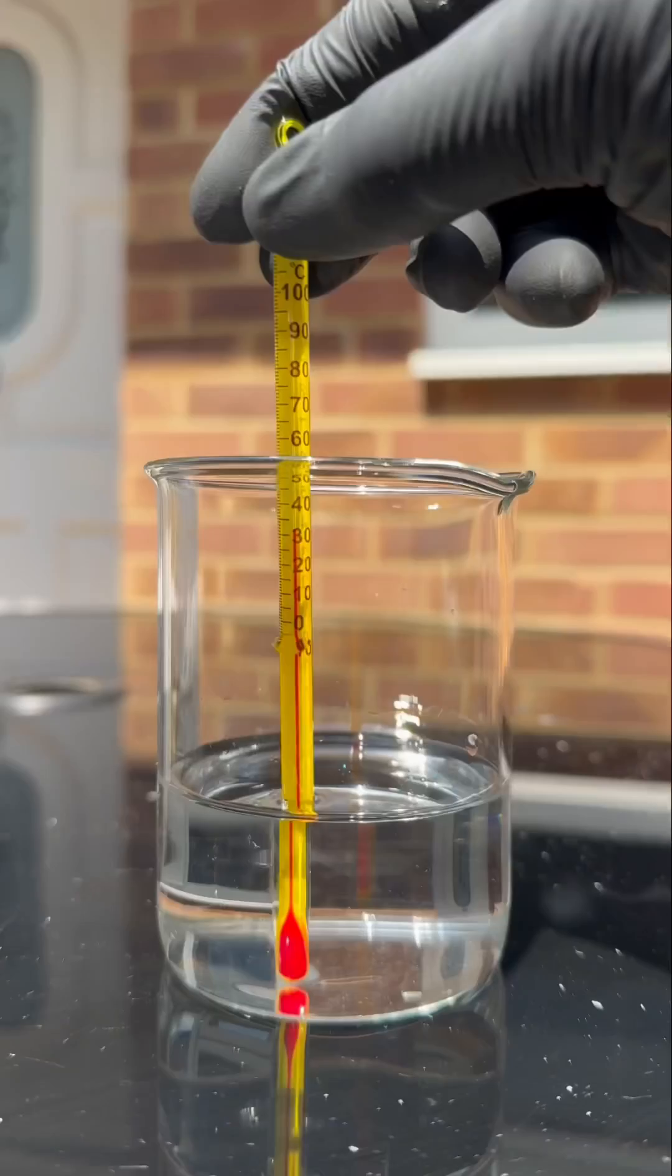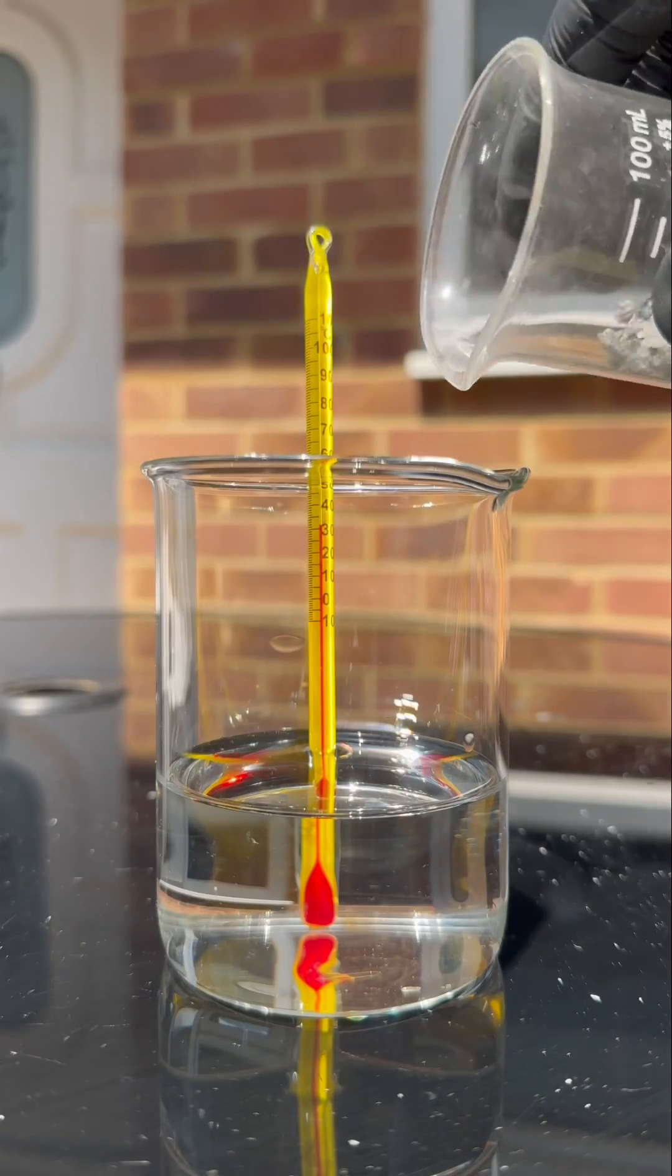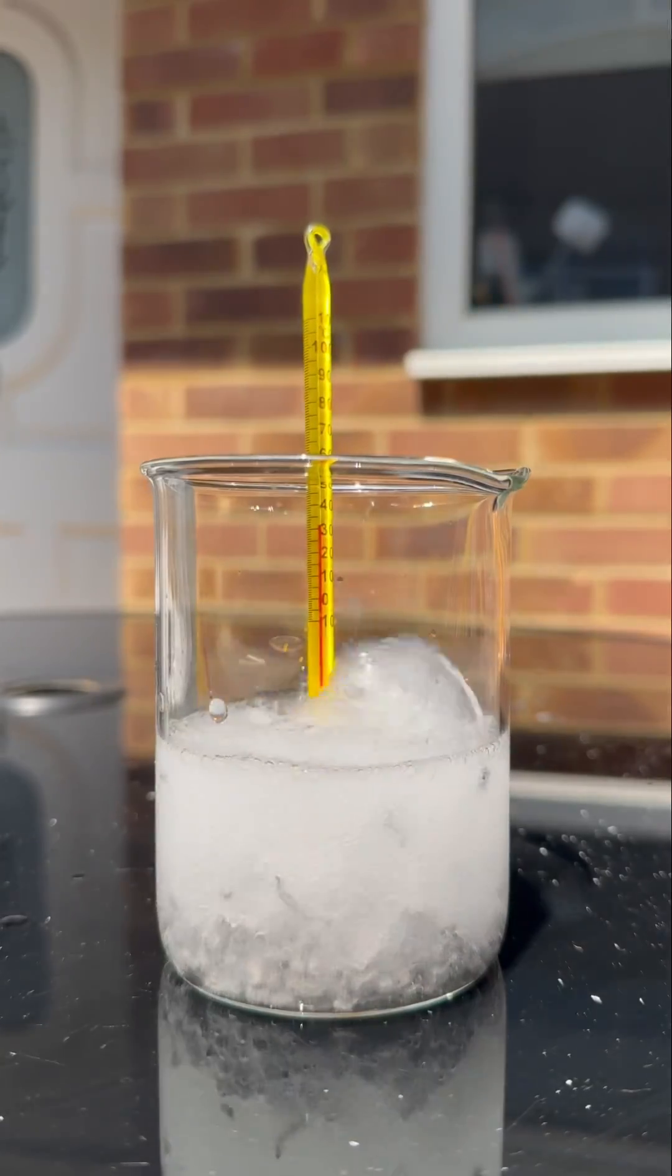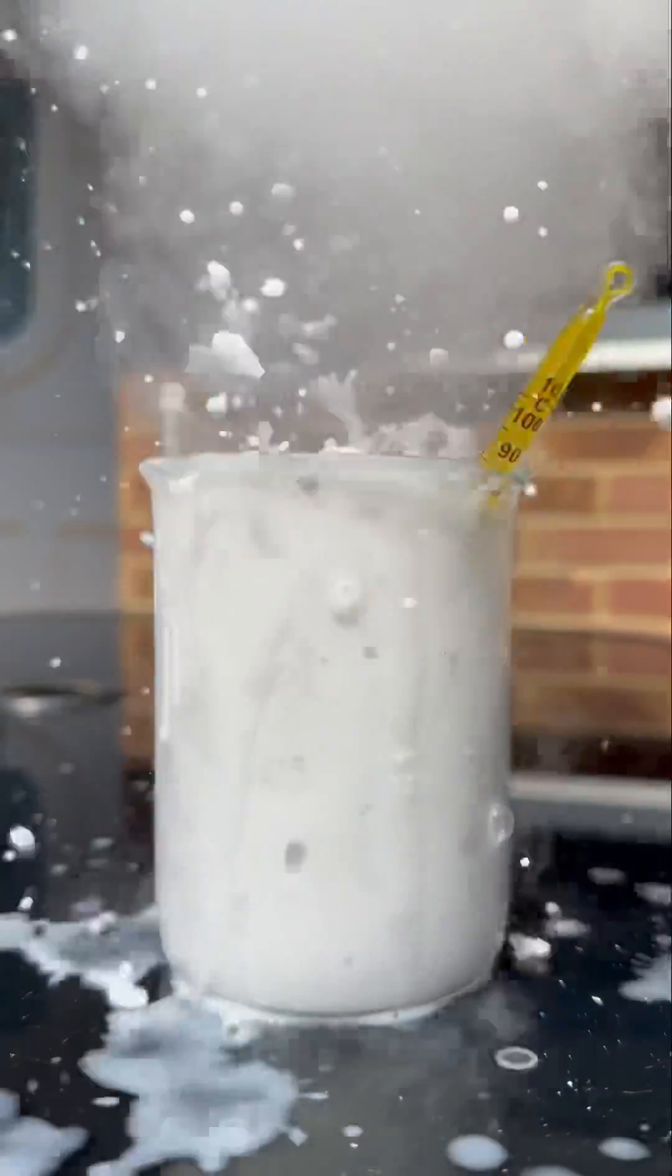And that's just over 30 degrees. Alright cool, slap the calcium in there. Yeah, look at that bruv, instant reaction. Bare smoke here, fizzing up in that fam.